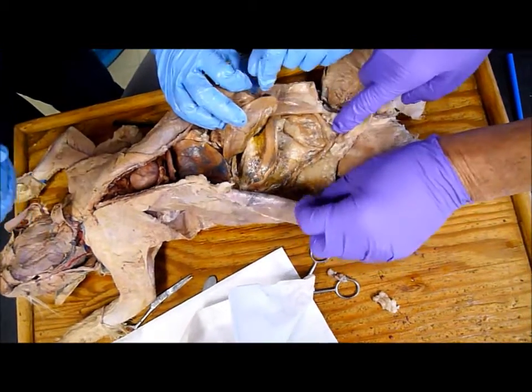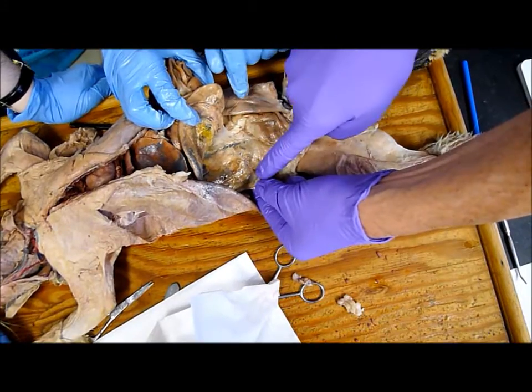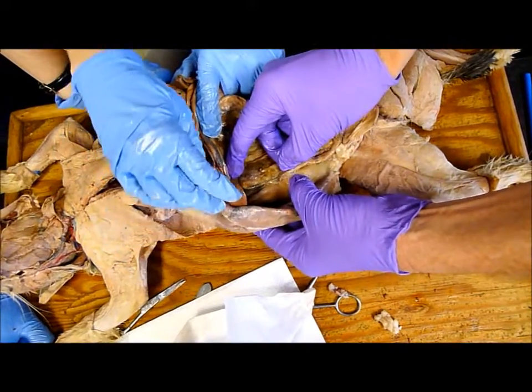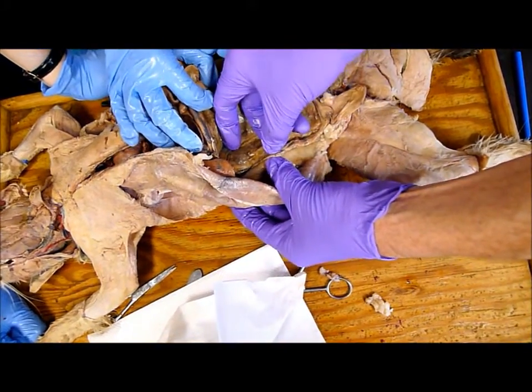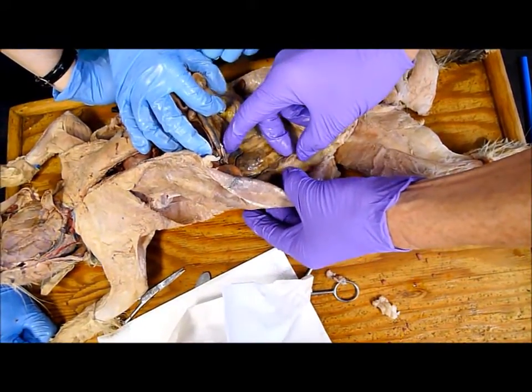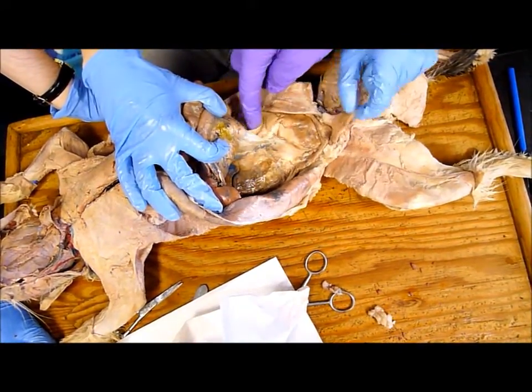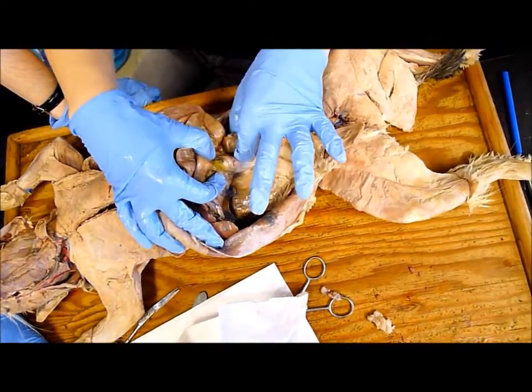This is the uterus, and there's the uterine tube. Right there's the ovary, and that would be the uterine tube — the oviduct, or fallopian tube — right there. And this is our urinary bladder. And a kidney here, and a kidney there.